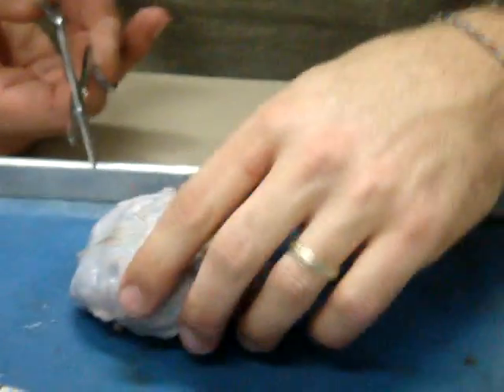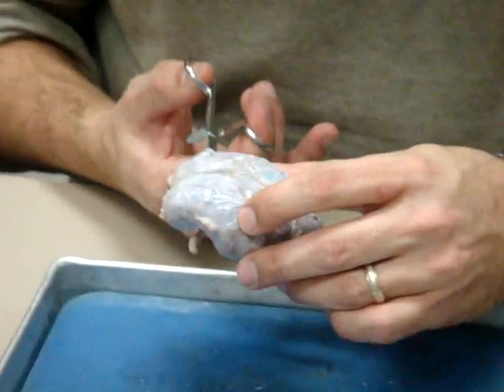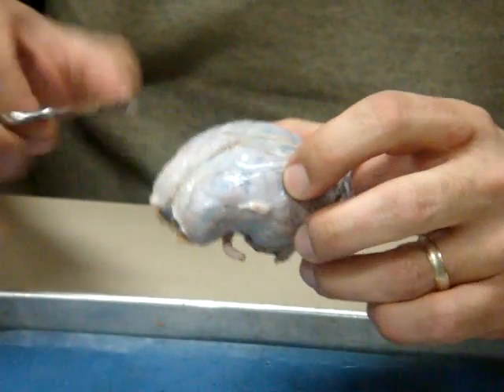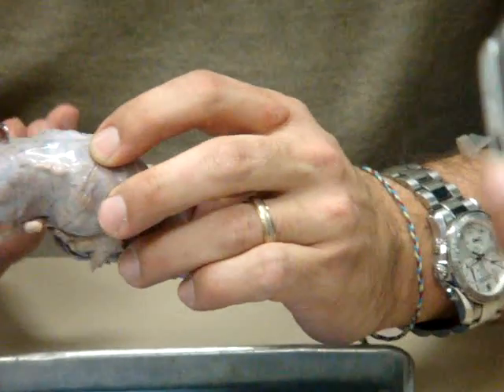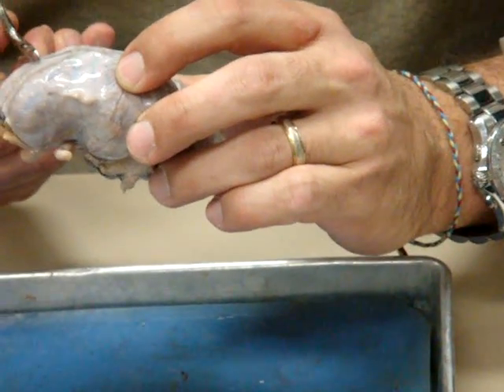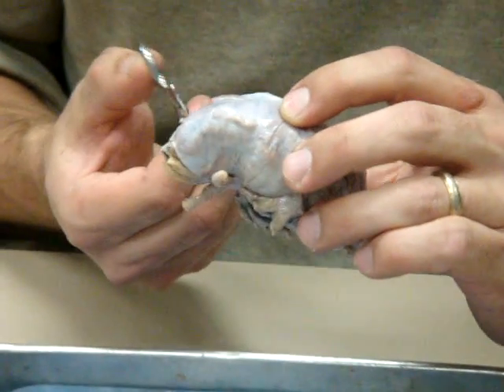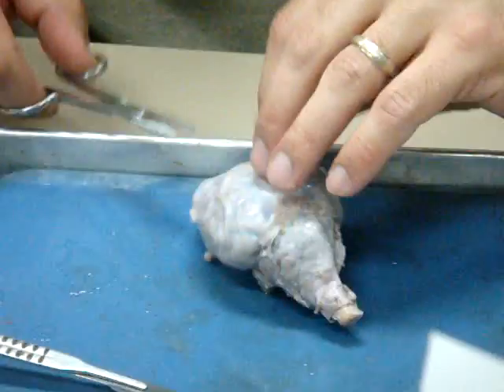Slippery little guy. I'm going to get in there, and you can use the blunt end just to make sure you're not doing too much damage. But I promise I'll be careful. Okay, and I'm going to cut across. Now you'll feel it's a little bit thicker in the middle. You may have to dig the scissor under a little bit just to cut this section and then to the other side. And I'm going to just remove a little section just to show you something here.